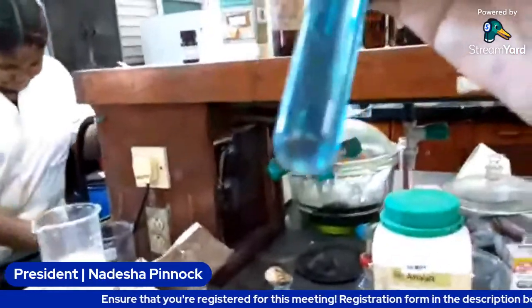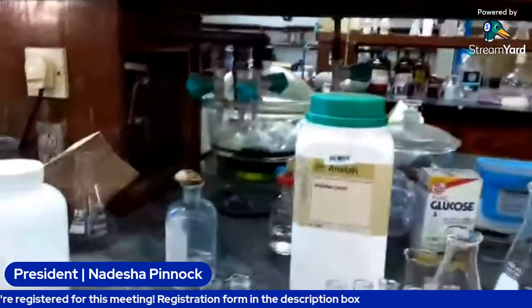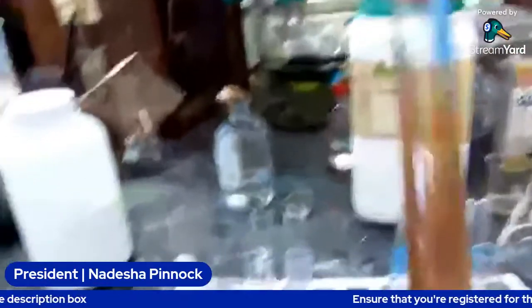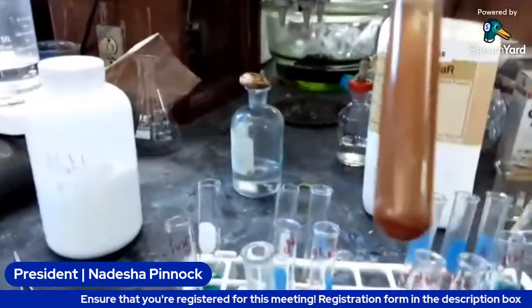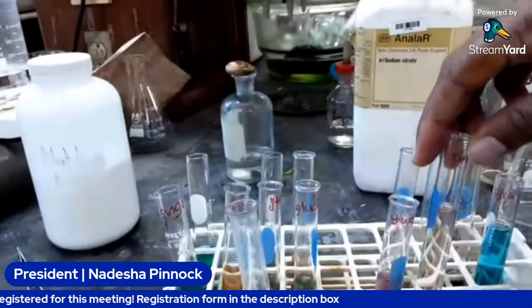But this is the syrup that we had, remember, when we did it without the acid, which was this one. I guess most of the syrup is like fructose or glucose, simple sugar. So the acid really didn't do anything for it.